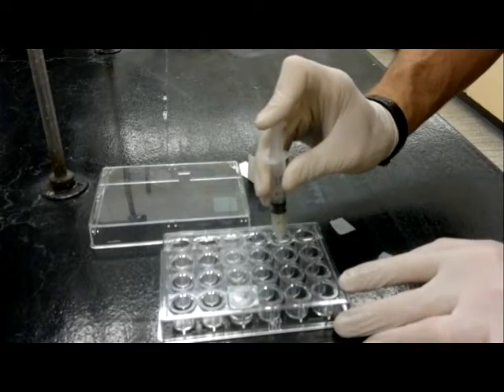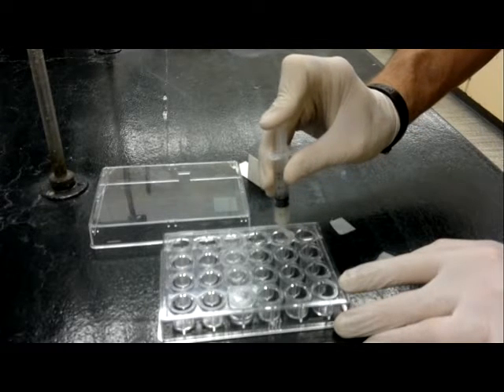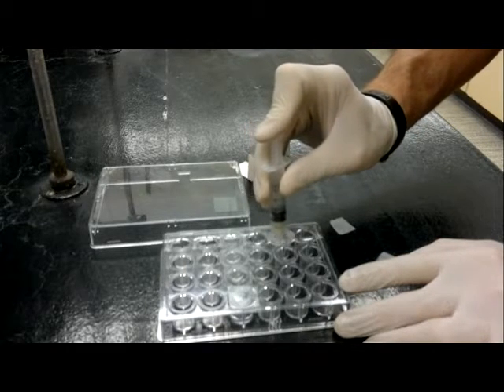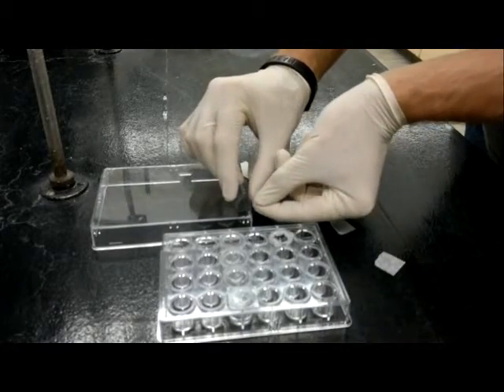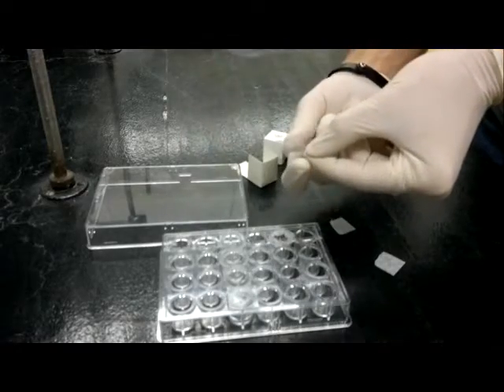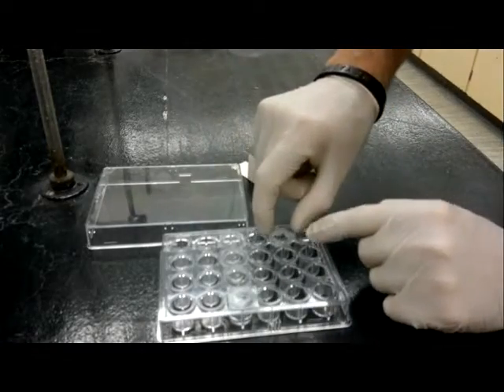Now if you're doing an individual well, it's actually fairly easy. Just apply a little pressure to your syringe. You should put what's called a bead of petroleum jelly around the outside. Set that aside. Your drop on top of your cover slip will actually be fairly stable. It won't come off. You can turn it upside down fairly readily without it actually falling off.